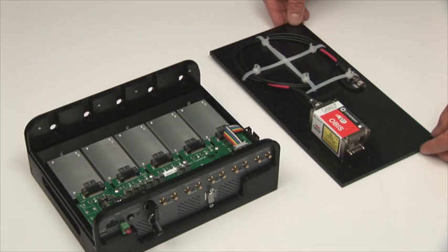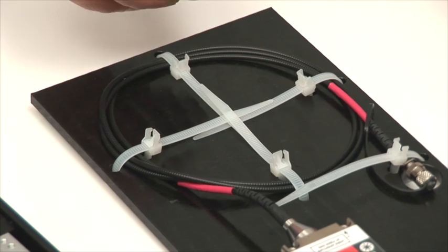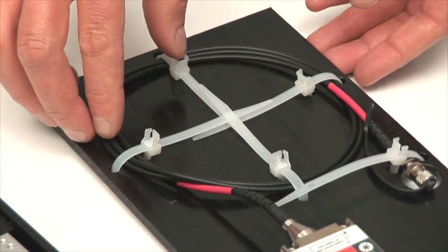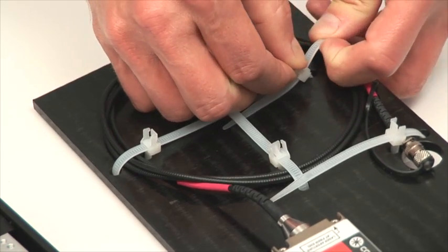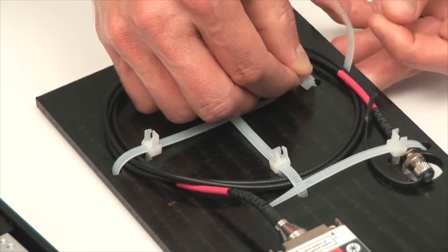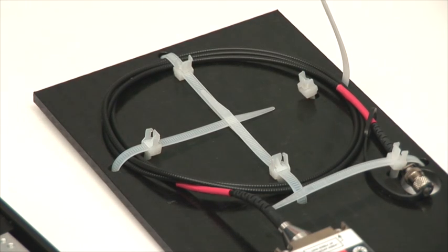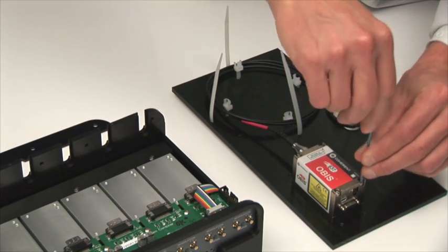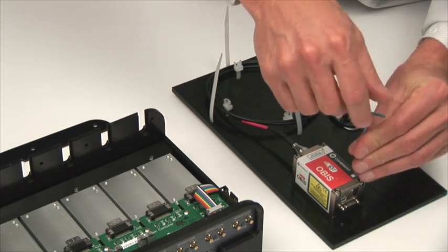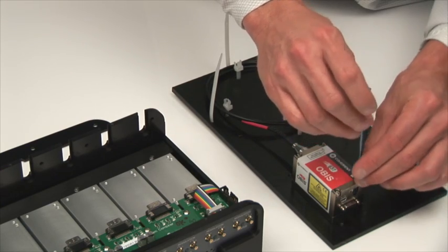The OBIS lasers are purchased separately for installation into the laser box. OBIS fiber pigtail lasers ship with a fiber on the tray and the laser mounted to the tray. To remove an OBIS laser from the tray, take the removable zip ties and loosen them to take the fiber off the tray, then remove the OBIS FP laser from the shipping tray using the four screws provided — these same screws are used to install it into the heat sink.